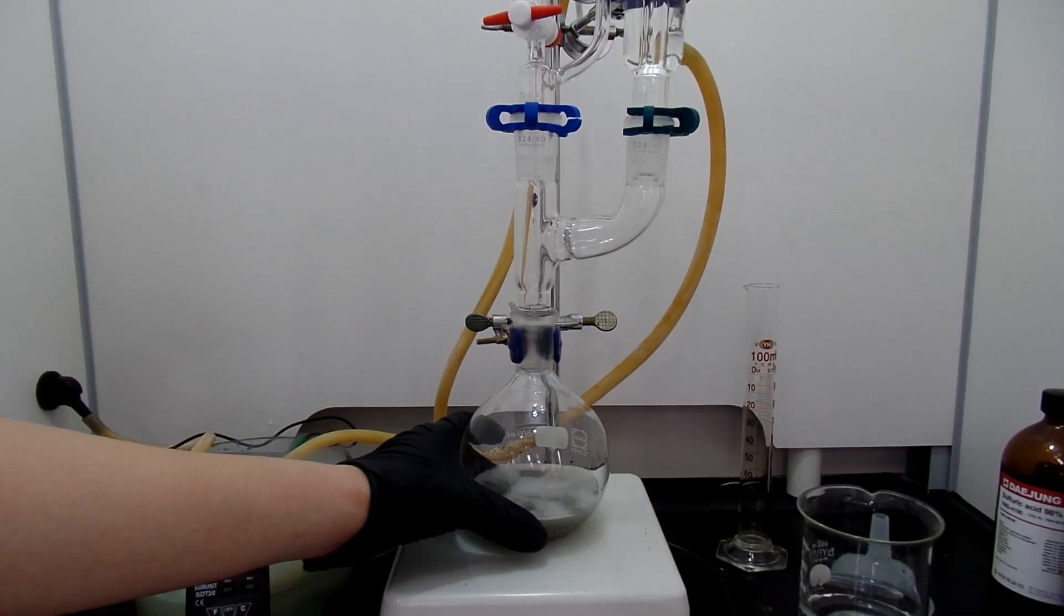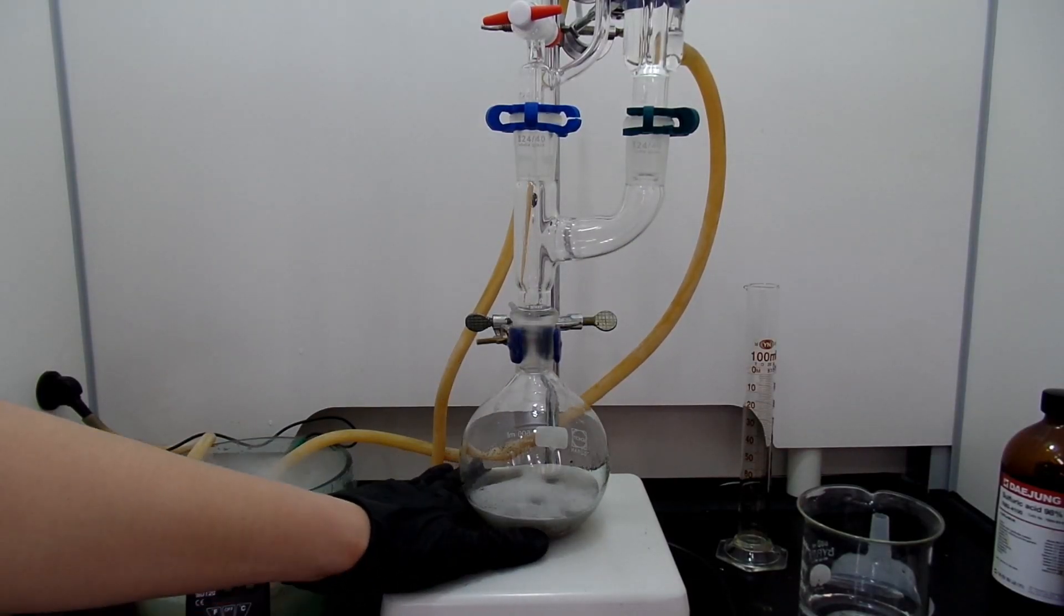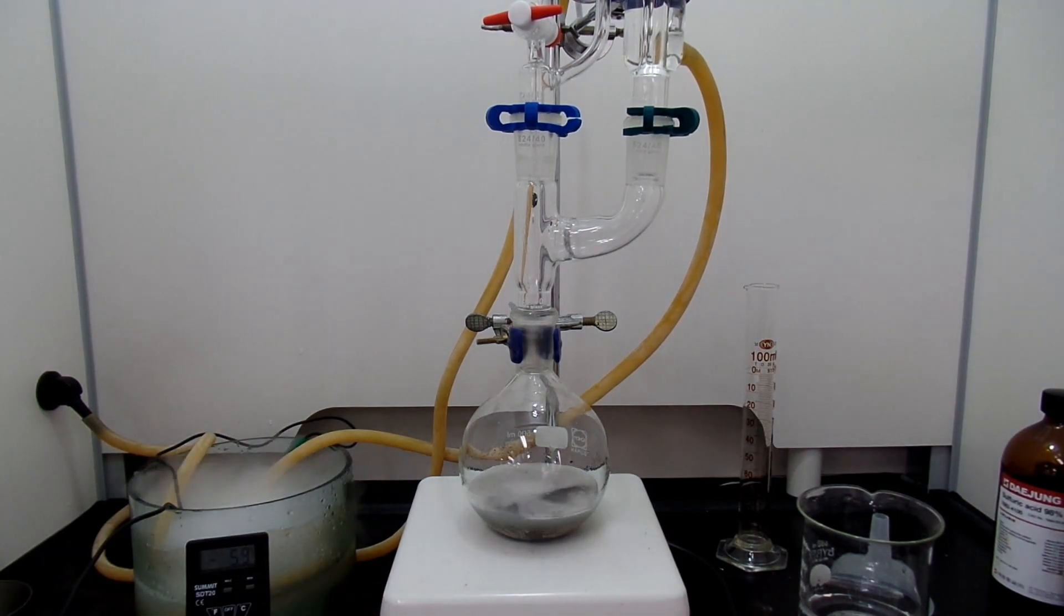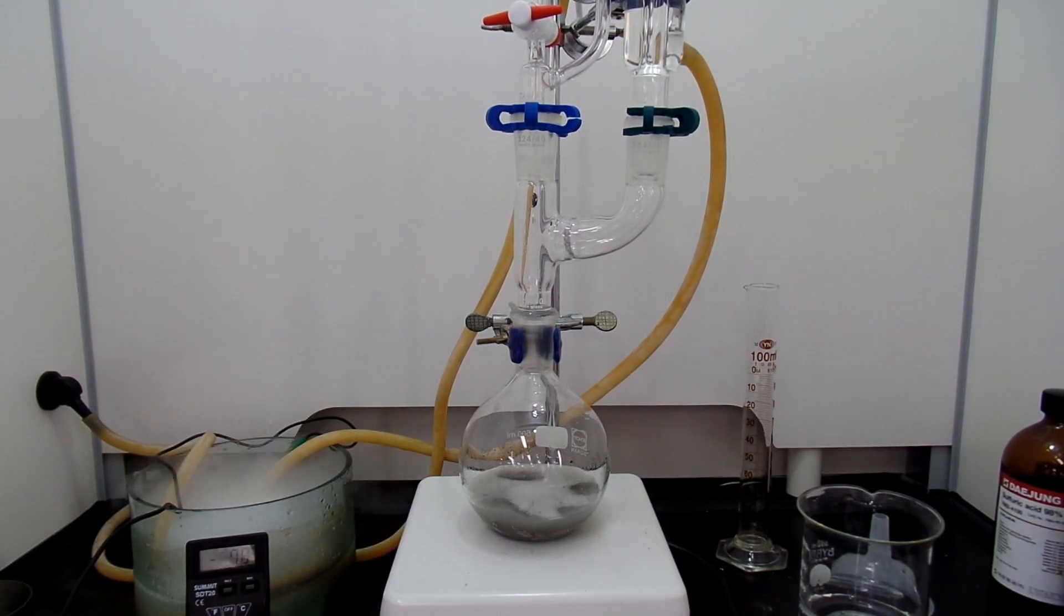So back to the topic, you should dry ether that will be used as solvent, your organohalide for making Grignard reagents, and carbonyl compounds that you will react with Grignard reagents. Seriously, this reaction is really susceptible to water contamination.